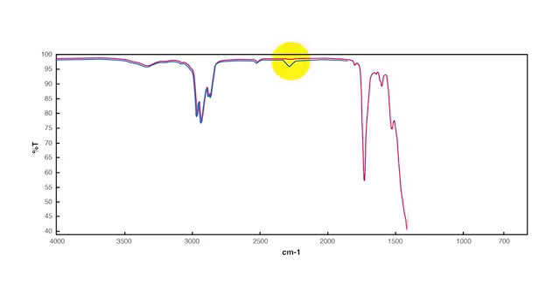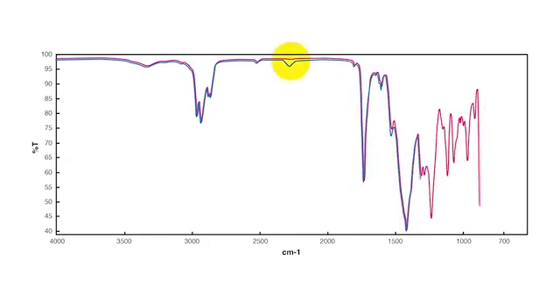To compare these regions, we superimposed the spectrum absorbance of the blue dots onto the spectrum absorbance of the pink areas. You can see a distinctly different peak at 2275 inverse centimeters. This is an NCO functional group. NCO is the reactive component of the B side of this formula, and its presence in the FTIR shows that it is unreacted because it was not properly homogenized during the dispense process.